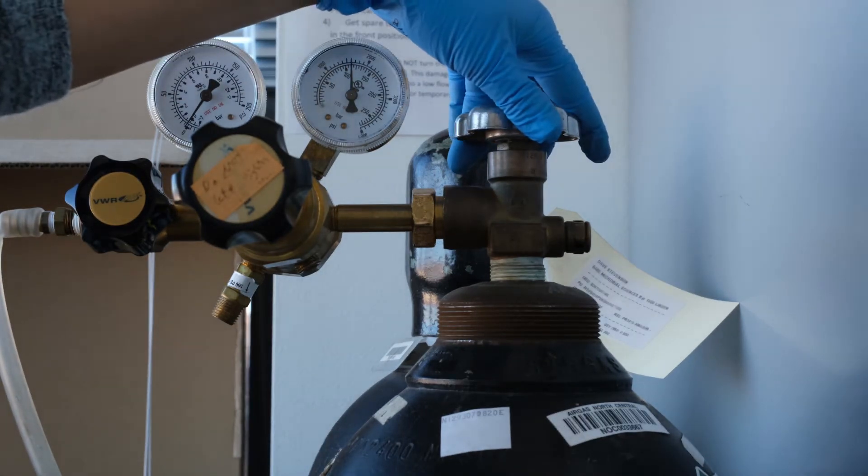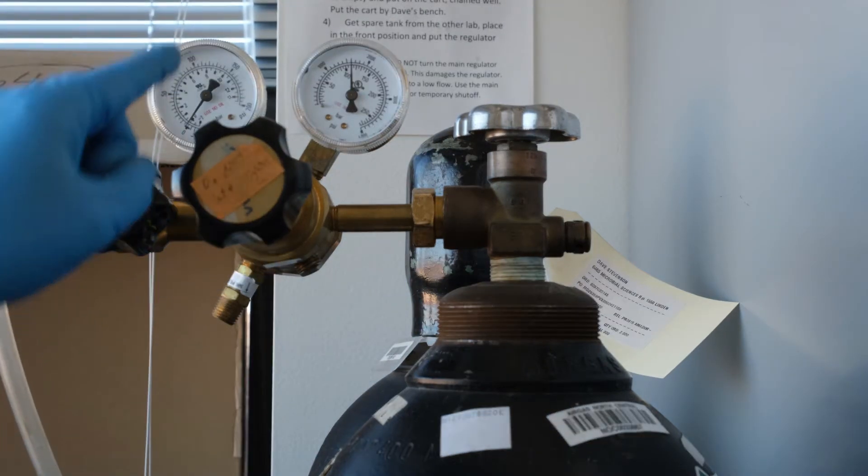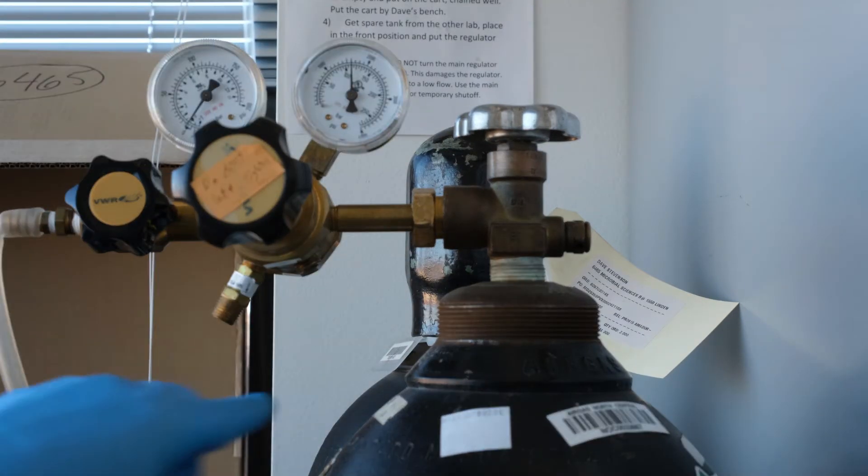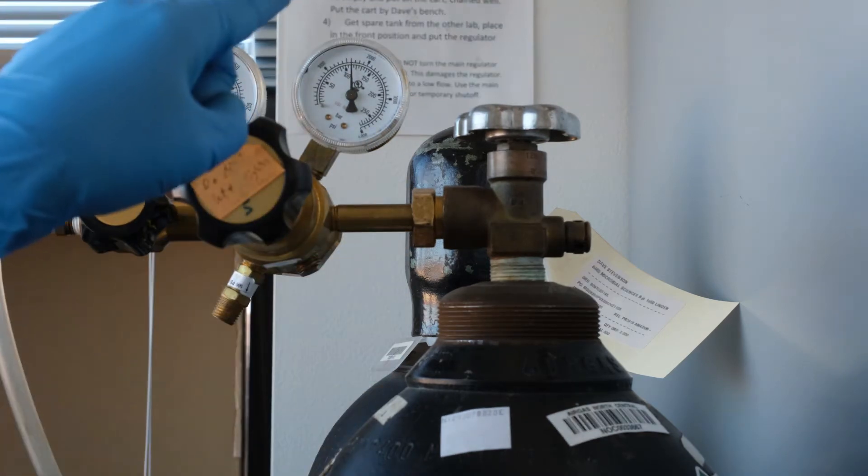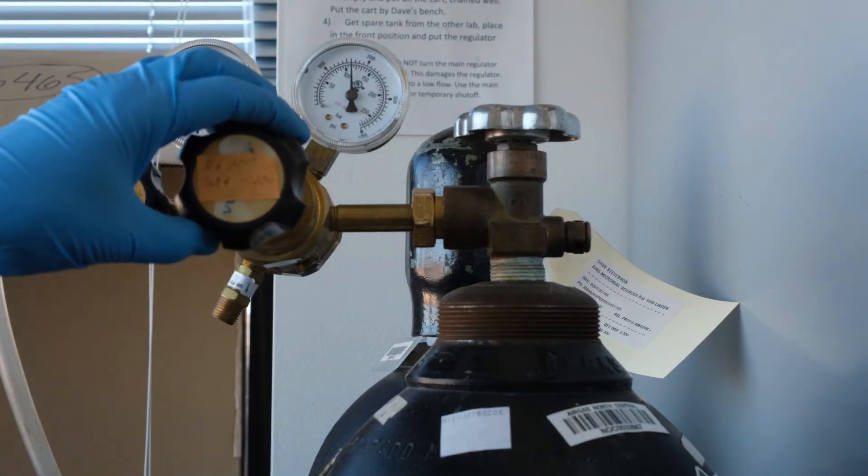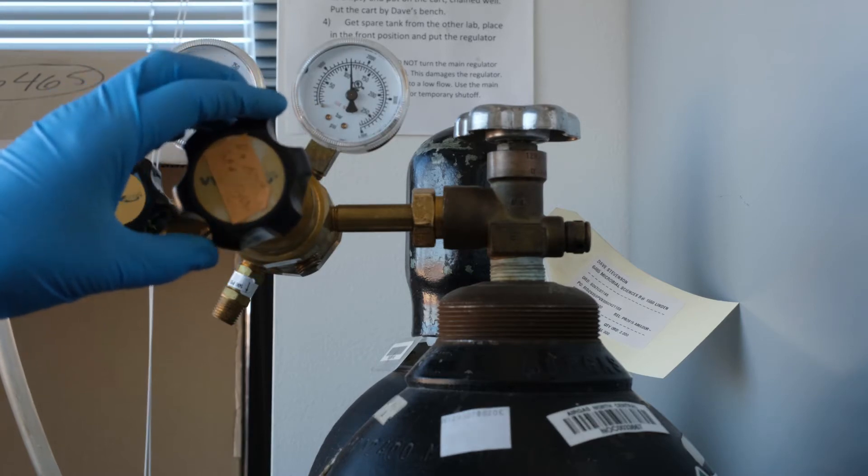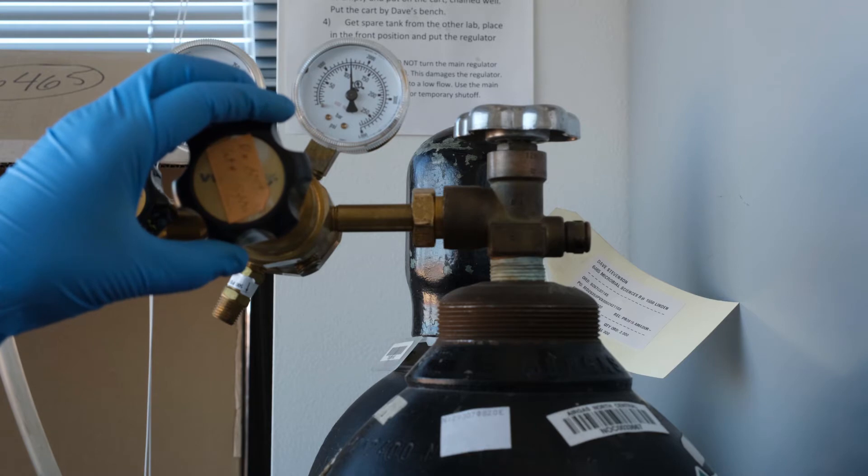Next, open the regulator. Note that for the regulator only, righty-tighty does not apply. Turn right to allow more gas to flow and left to restrict gas flow. Never fully left-tighten the regulator. This will damage it. Instead, base your decisions off sound. You will hear the gas escaping when the regulator is open.